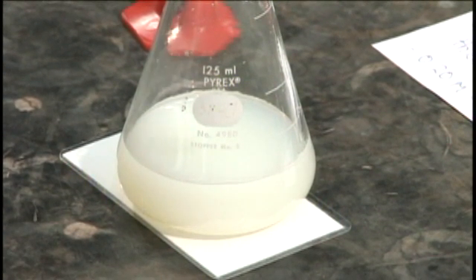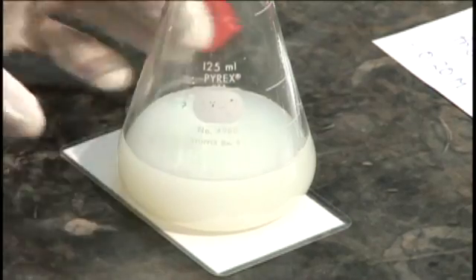That was 16 seconds. We record our start and end time.